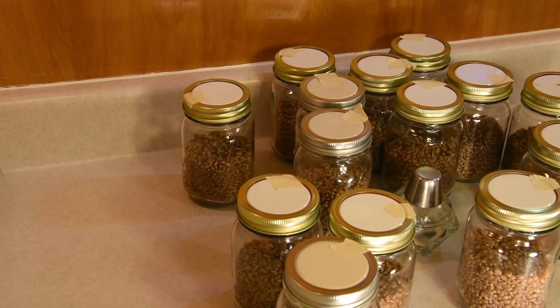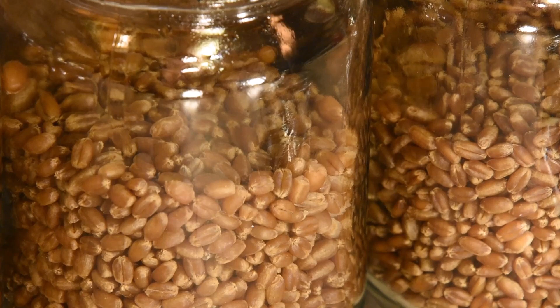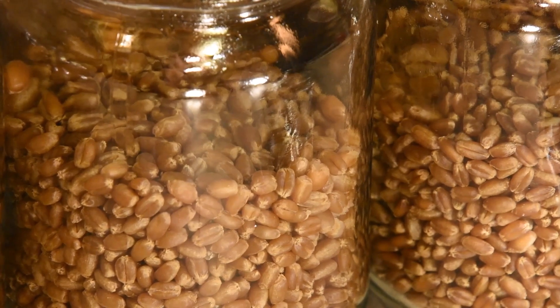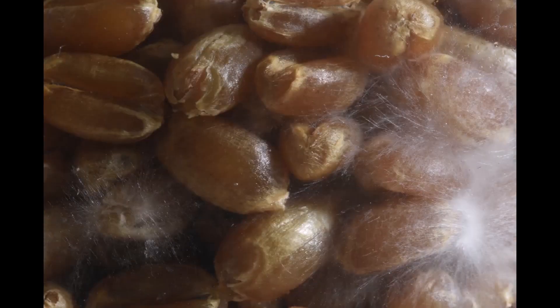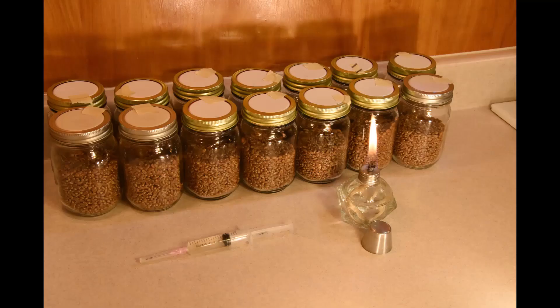And that's it — this is the finished product. The grain is properly hydrated and just a few drops of liquid inoculum have been put in there. There's really no way to tell that it's been inoculated. But about three days later you can start to see some mycelium developing — we'll get a couple of close-ups. You can see it jumping off from what was a small piece of mycelium floating in the liquid culture, spreading like a spiderweb, and inoculating the whole jar at about 30%. I'll shake it around to try to speed up the inoculation.